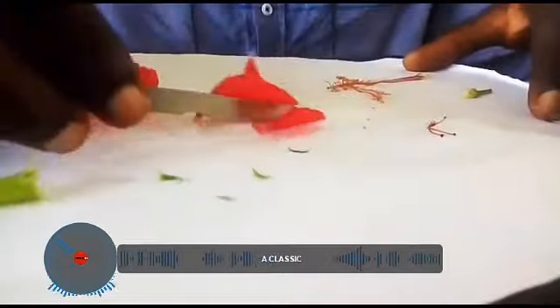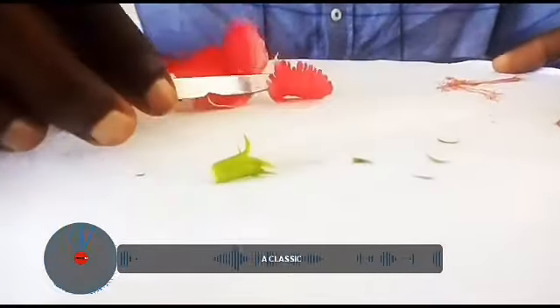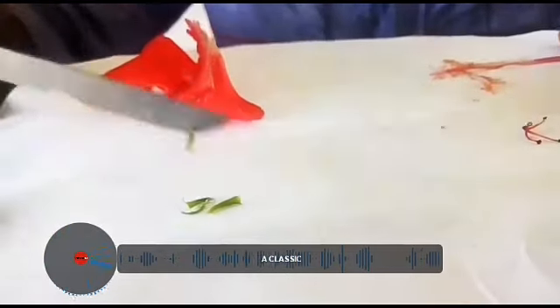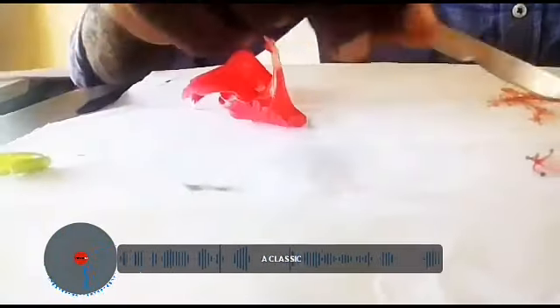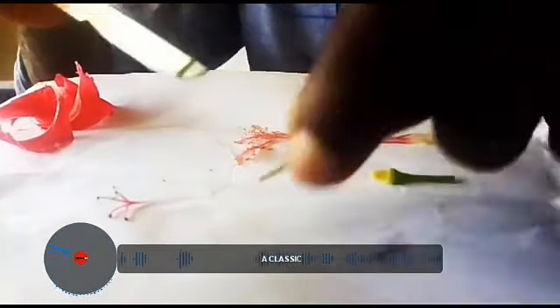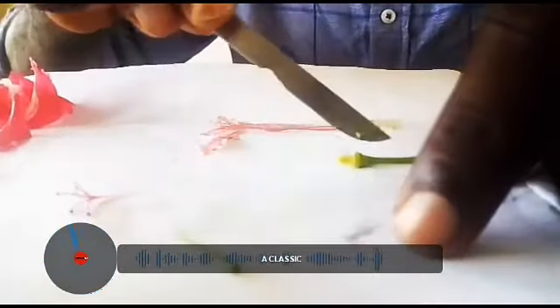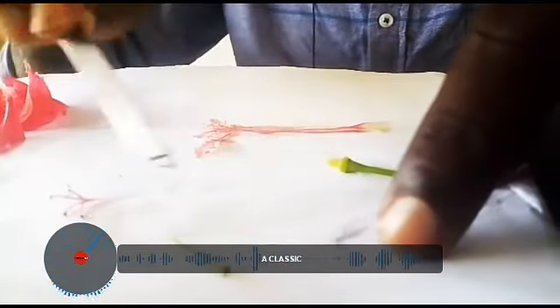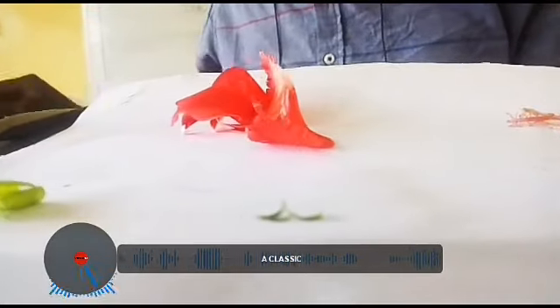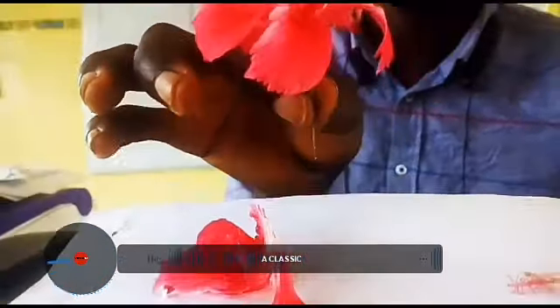So if you look at the other structures, those are the petals, then we have the sepal, we have the epicalyx. So in the dissection proper, we have seen different sections of the hibiscus flower. That's part of the pedicel. You have the receptacle, the whole length of the pistil. So we have seen different structures that make up the hibiscus flower.